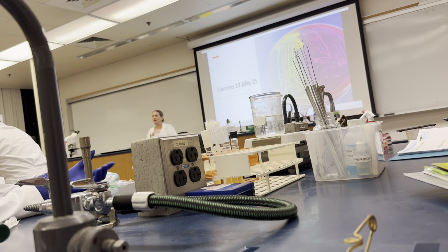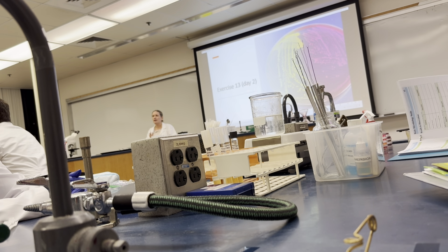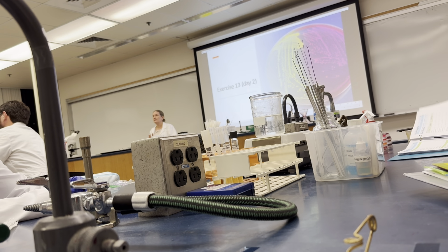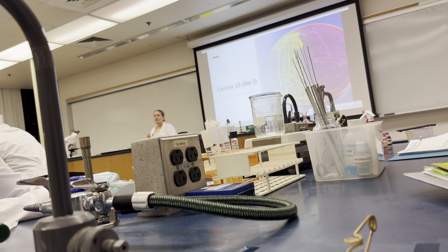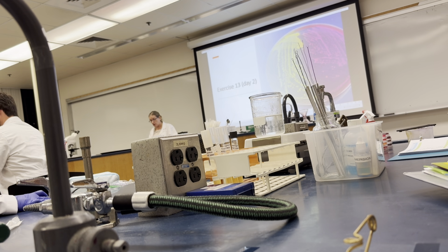We're going to go through just all of these. We're going to talk about each of them. We are going to be recording our results on page 93 and 94. So we're going to go through each of these as we do so.